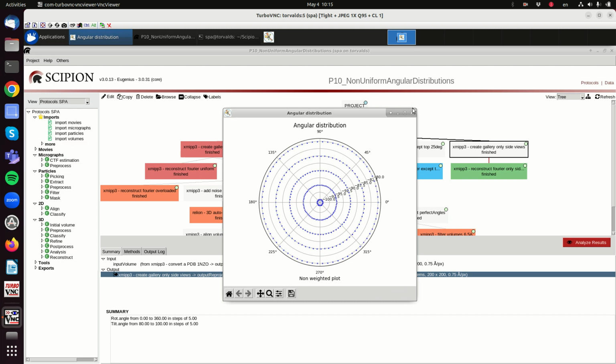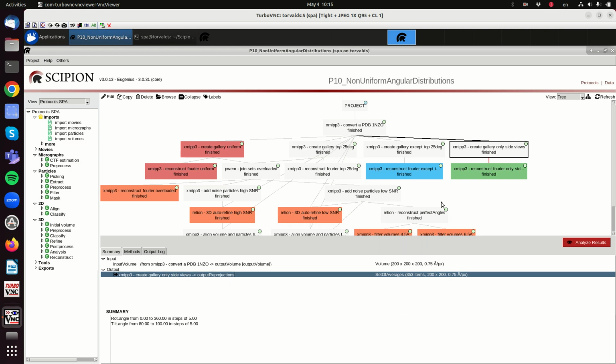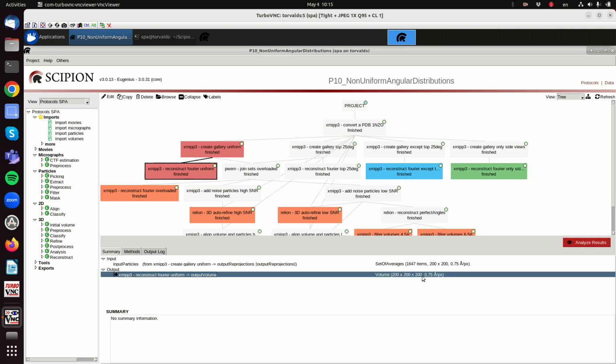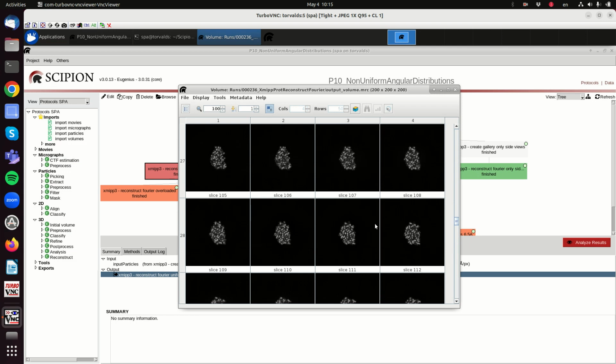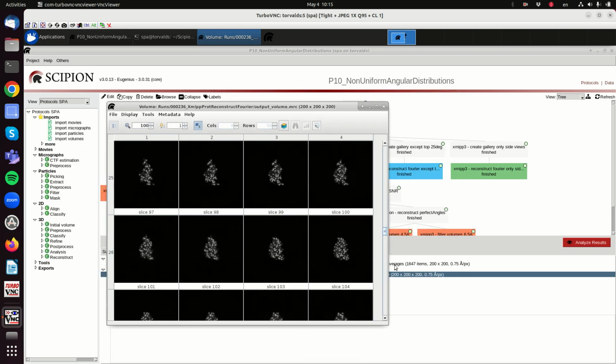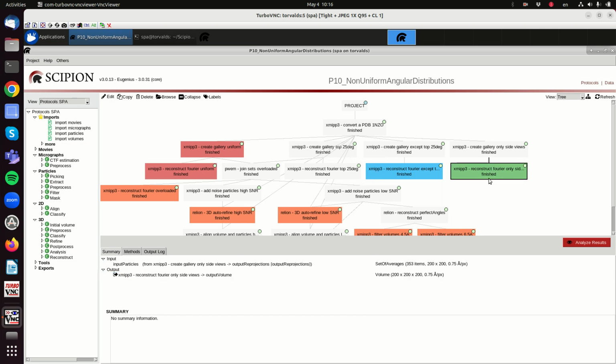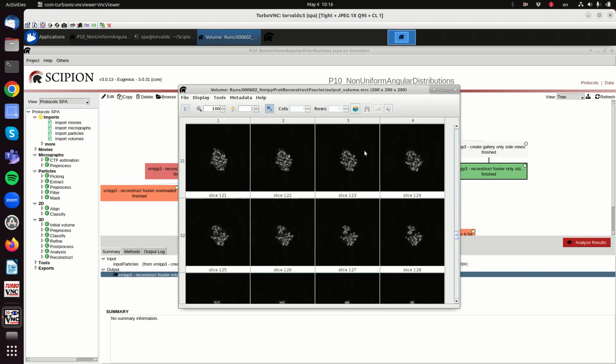Okay, so with the perfectly uniform distribution, we should get a very good reconstruction, even if there are very few particles. Even if they are only 1600 particles, we see the structure pretty well. We don't see artifacts in any direction. So this looks like the original one. And with the other two, what happens if we only have side views? Only 300 side views, but still the reconstruction is pretty good, and we don't have any obvious artifact.